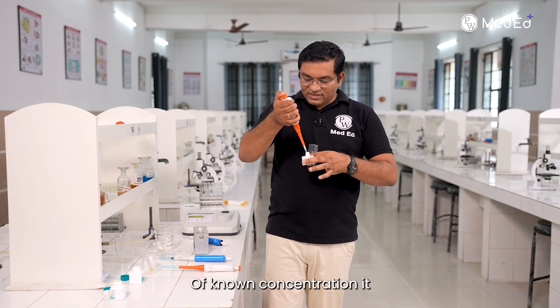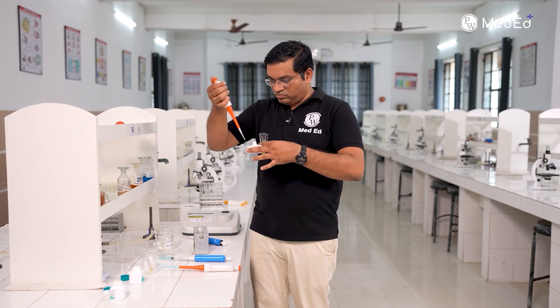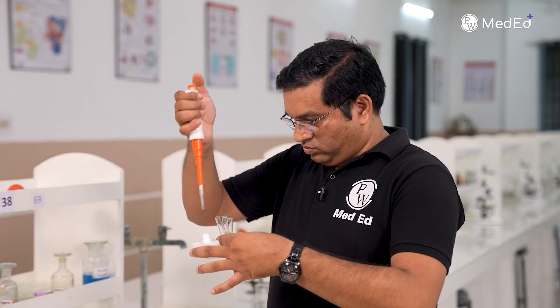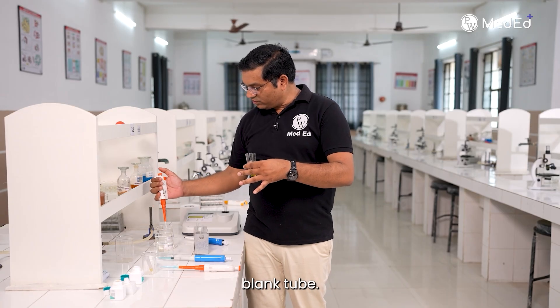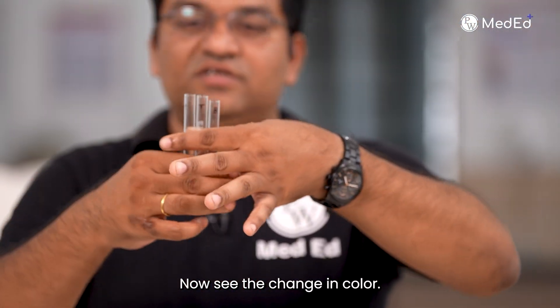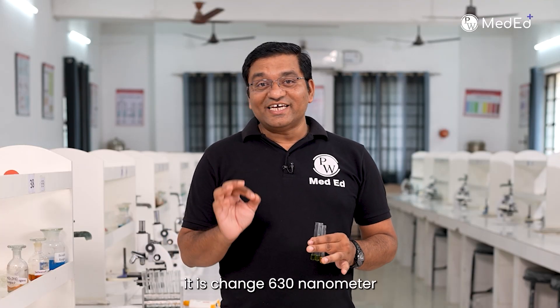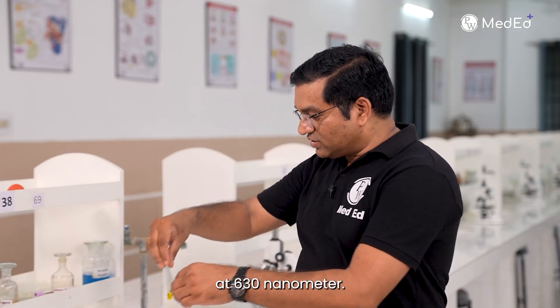The standard of known concentration is added in the standard tube. See the green colour in the standard and test tube. Take the optical density at 630 nanometers — the colour filter is changed to 630 nanometers for the green colour. Observe the optical density at 630 nanometers.